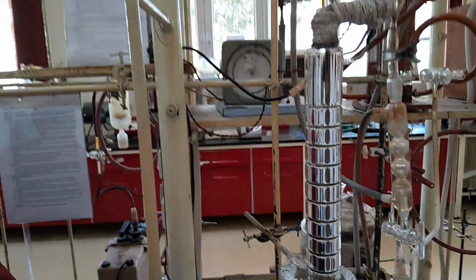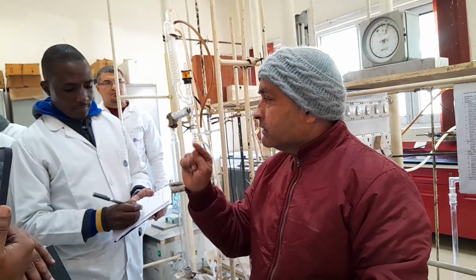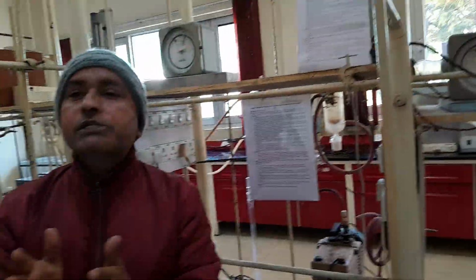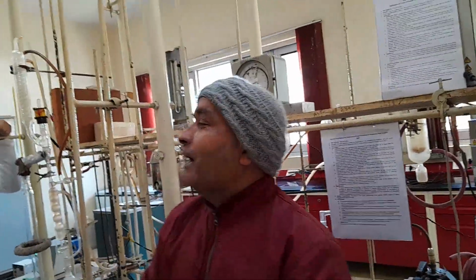It has got actual 30 plates, and in one plate there are 80 holes, and the diameter of one hole is 0.3 mm. Got my point? So this column is taking the role of the interaction media. How many trays, that I will let you know later. You can ask me each and every question.